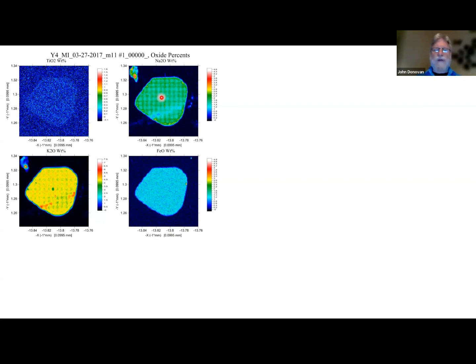But it doesn't matter if it's irregular, we can correct for it. So here's the correction without TDI. Okay, and how do we do TDI on maps? We do multiple frames. We acquire, instead of doing one long map, a number of short maps, okay? And the software is designed to automatically take each pixel and extrapolate it back to 0 time. So we get a perfect correction for every pixel in the map, for not only the matrix and background and everything else, but also for the TDI effects, which stands for time-dependent intensity, if I didn't explain that.